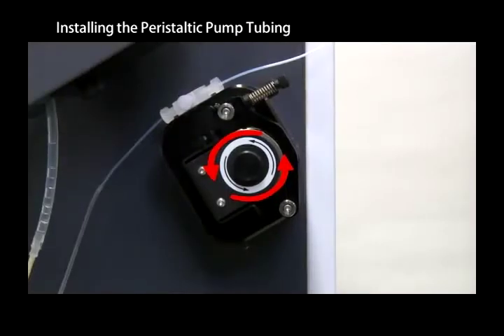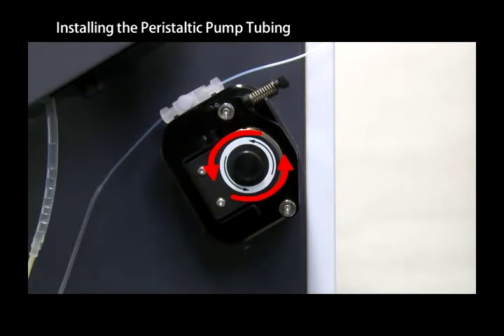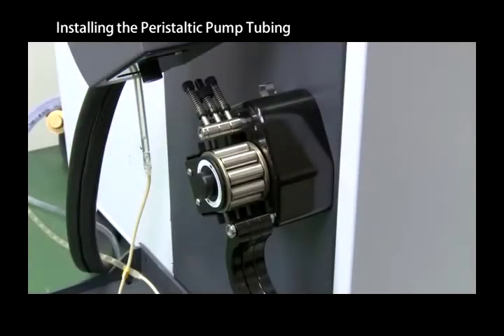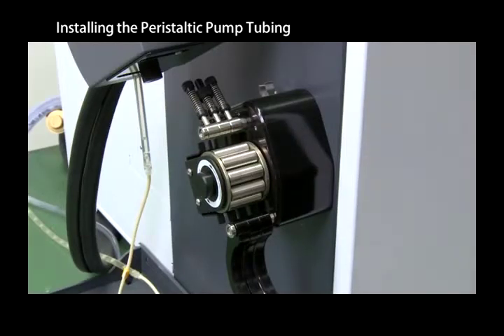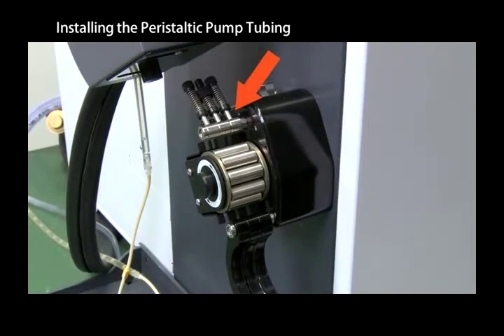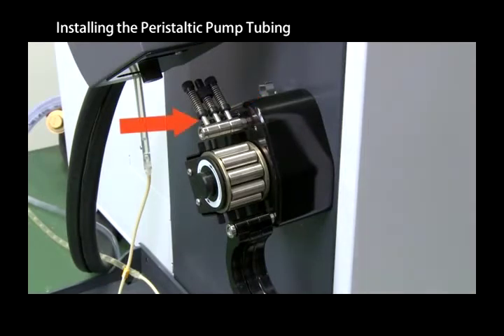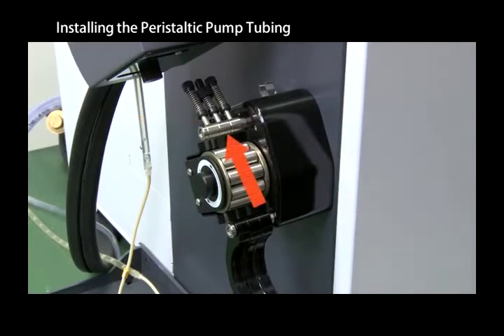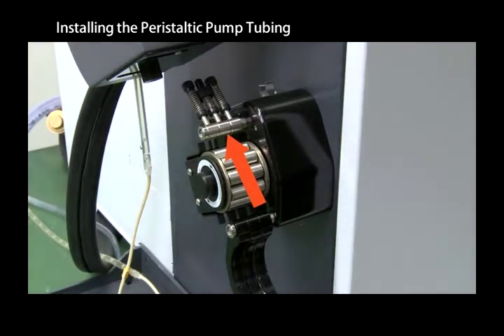Check the direction of rotation of the peristaltic pump as indicated by the arrow on the pump. Note the installed position of the tubes. When facing the pump, the drain tube is on the right, the sample tube is on the left, and the sample tube for the internal standard solution is in the middle.